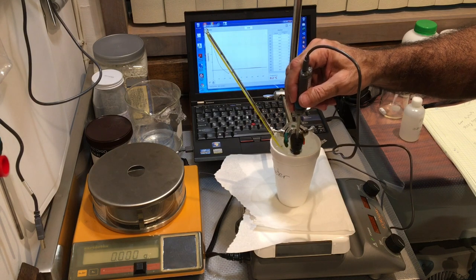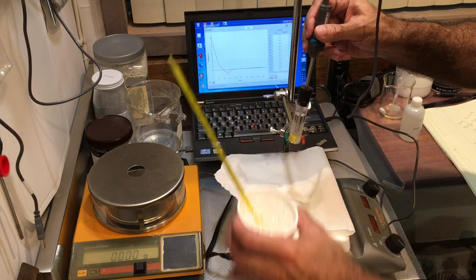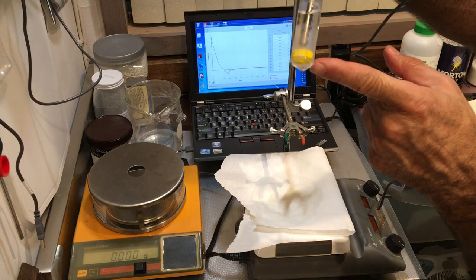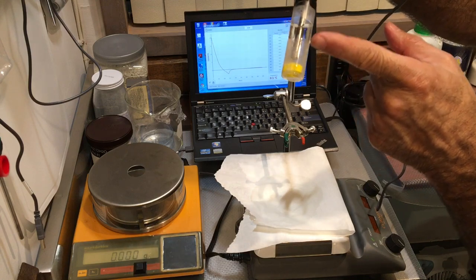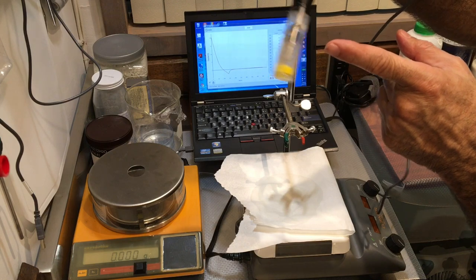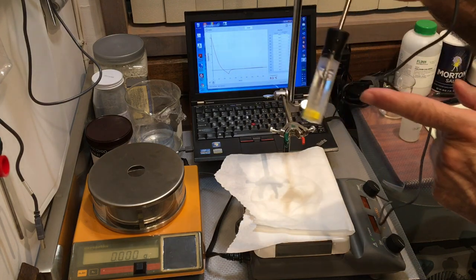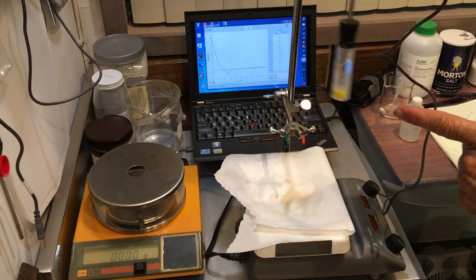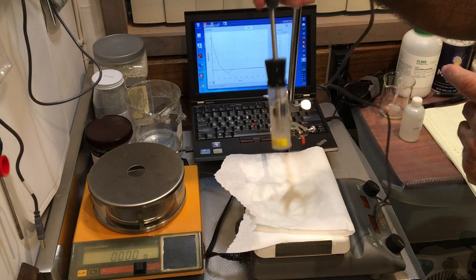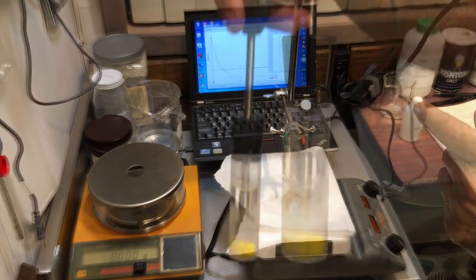We can take this off and let it melt. Here's the ice — this part is completely frozen. The temperature is remaining at zero degrees because we have an ice-water mixture, and as long as you have that mixture, you essentially have a zero degree temperature.